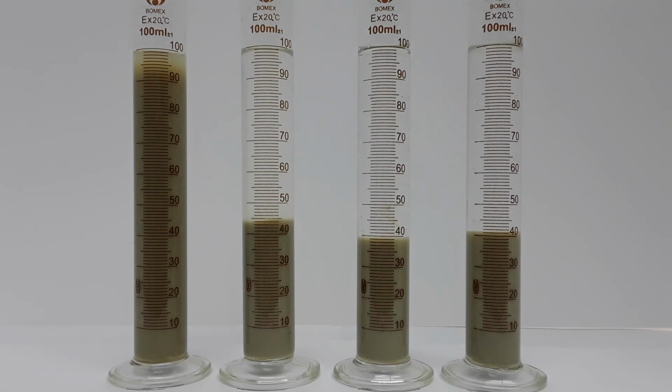We see that the fresh water was readily absorbed by the clay and swelled to 8.3 times the original clay's volume, but would have swelled even more so if a larger volume of liquid had been added. In the case of seawater treated with potassium chloride substitute, the amount of swelling is significantly reduced in comparison to the fresh water, but the clay still swelled to 3.7 times its original volume.